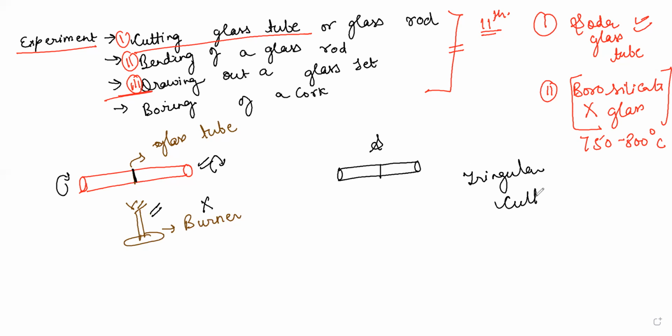A triangular cutter will be used for the cutting here, which is also called a triangular file. With that triangular file, I'm going to scratch it on this side. Now again, move it to the other side and scratch it again using the triangular file. After that, using your hand, apply a little pressure from this side and this side. A little pressure is required, not too much force. What you will notice is that you get it in two halves.